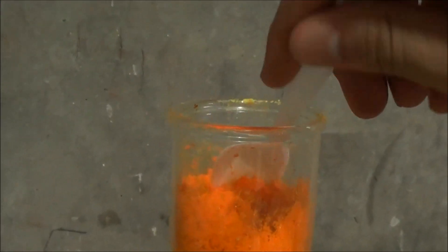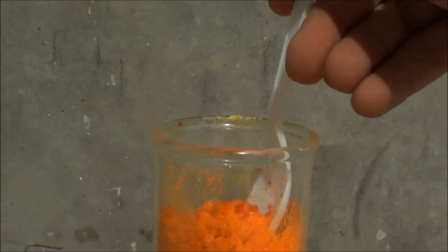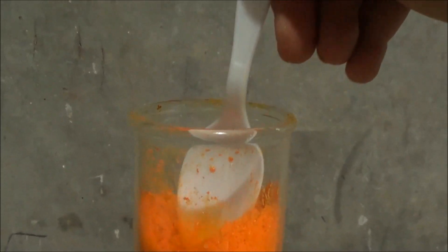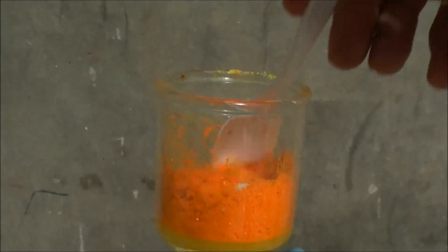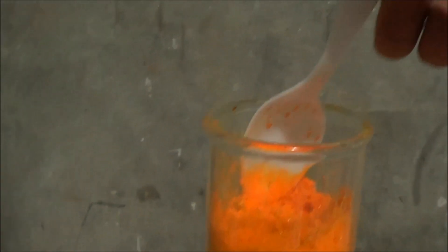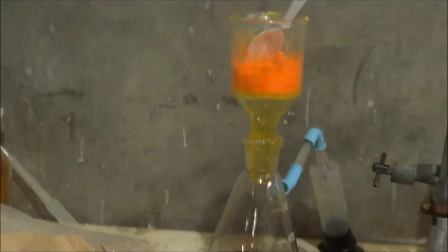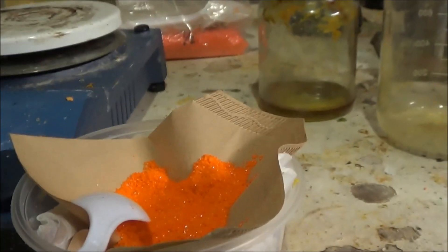Which, you know, I've lost like a lot of product here. But it's looking like very good purity, and that's what I want. I want small amounts of high purity, as opposed to lots of a lower purity.